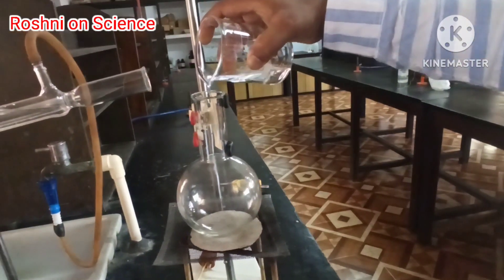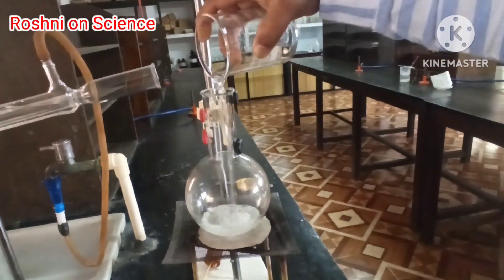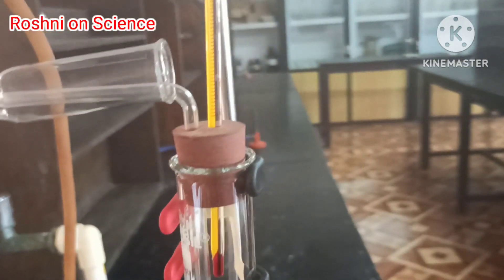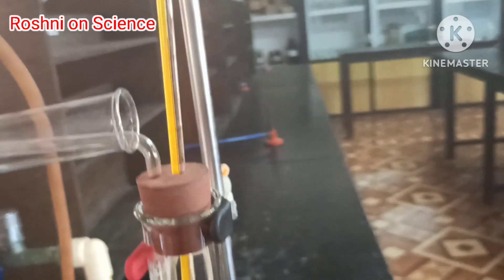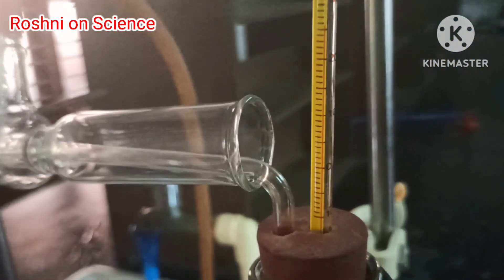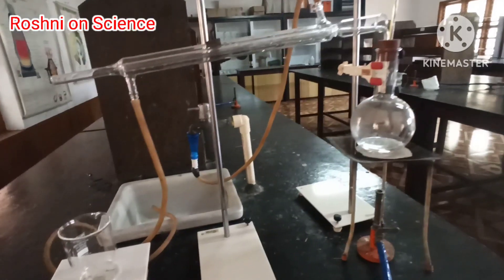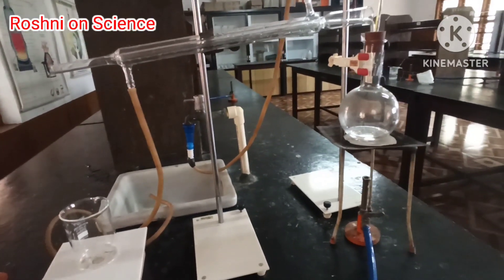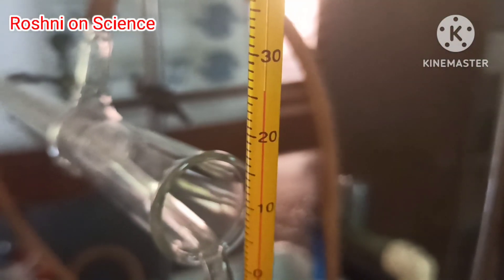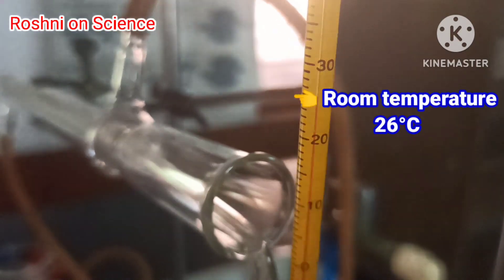Pour this mixture into the distillation flask. The distillation flask is fitted with a thermometer and a Liebig condenser. The room temperature is 26 degrees Celsius.